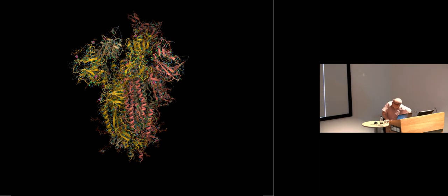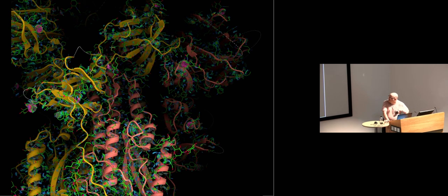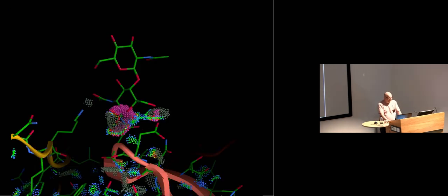So if I turn on that's not great, but if I zoom in a bit, what I'm looking at here is the contact interactions. You may be familiar with MolProbity dots. This is the Coot version of it. And you can see that there are spikes going on at the carbohydrate positions here. Here's one, here's carbohydrate, here's another one. This one is okay, but there are, as you can see, lots that are not. And here's a typical example of that. So there's a problem with the link.